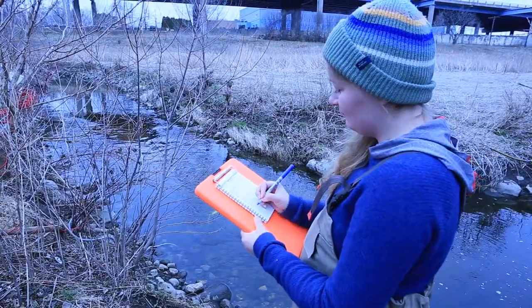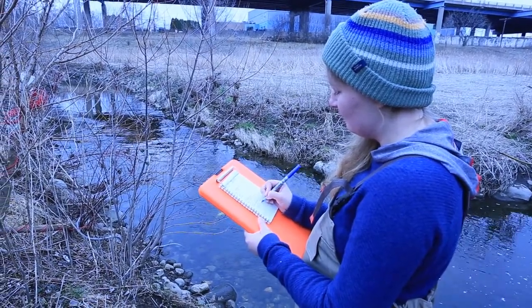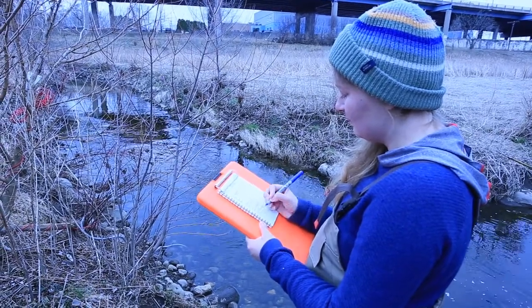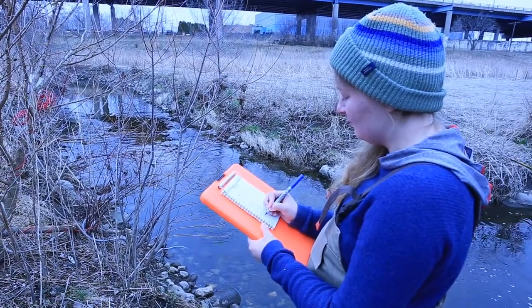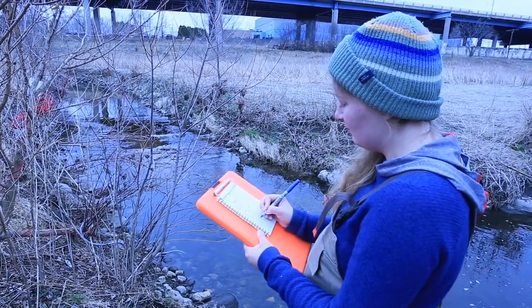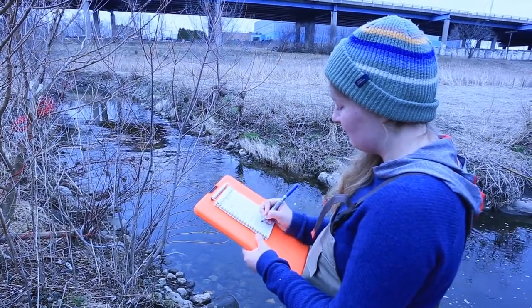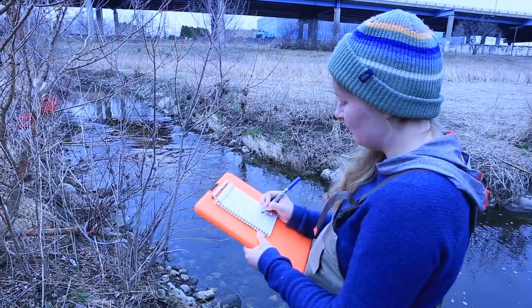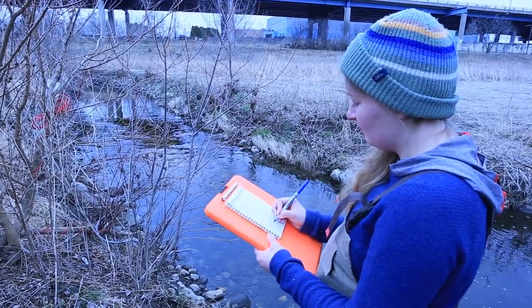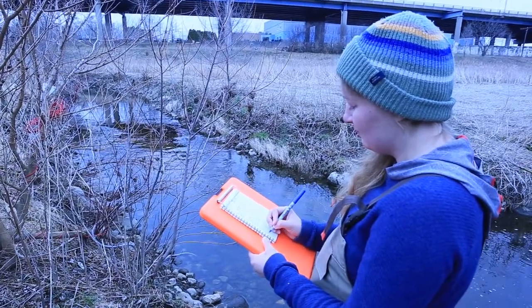Measuring specific conductance means measuring all of the charged ions in the water, not just chloride. When we see changes in conductivity, these grab samples help tell exactly what parts of the river chemistry are changing. By pairing the conductivity data from our stream sensor with our grab samples, we can estimate the amount of chloride in our waters from just a conductivity reading, and understand how much salt is moving through our rivers year-round.